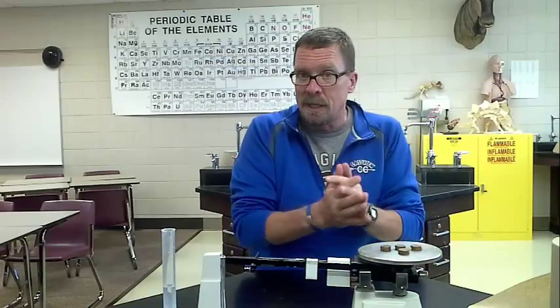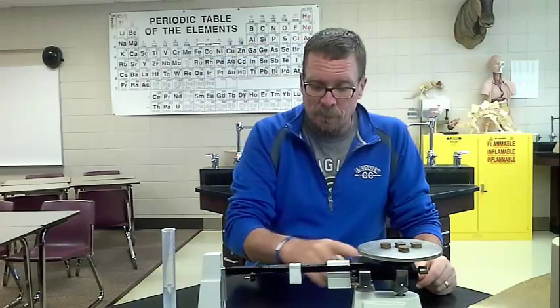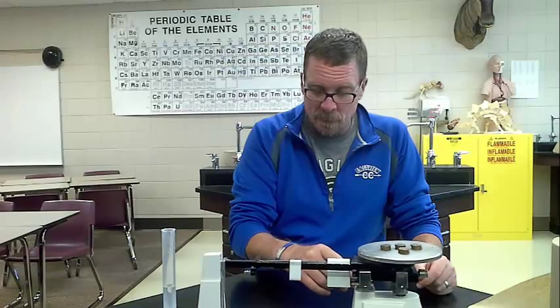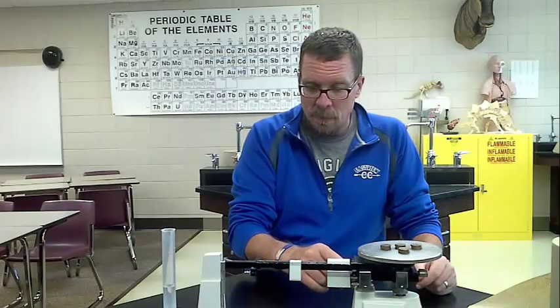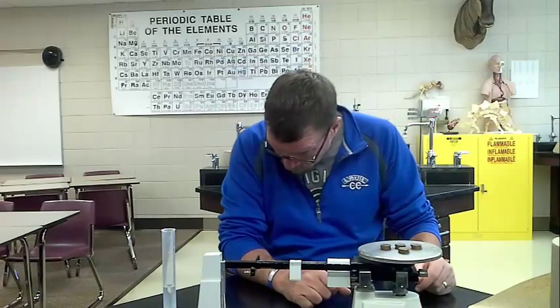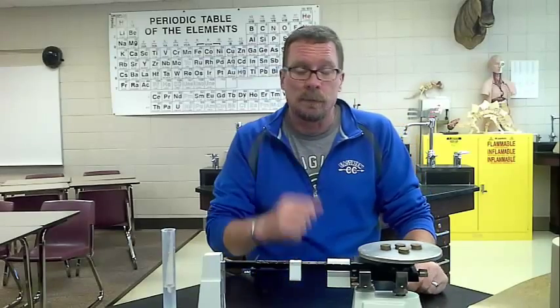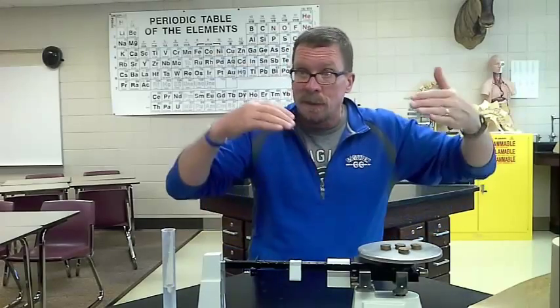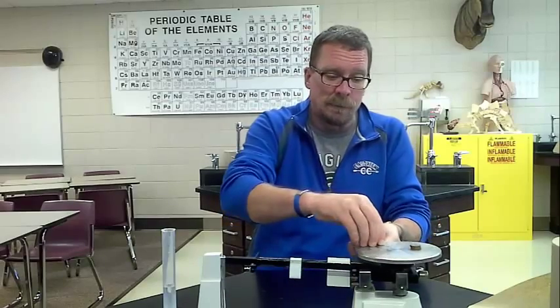So out of each set of years, I'm doing 20 pennies, but 5 at a time. Good. And that's at 60.90. So now I have all the mass, and I can just take all that data and record it on my data table.